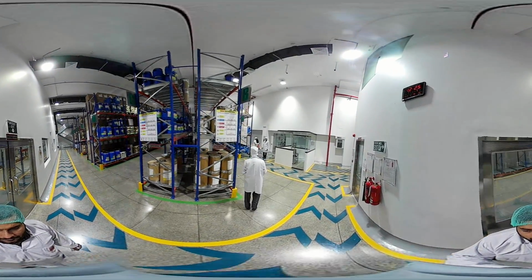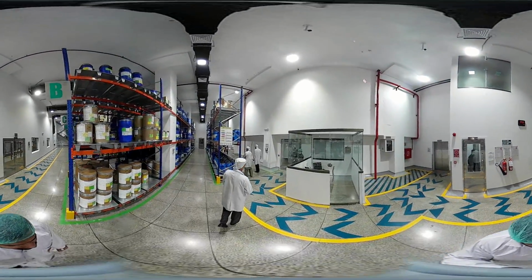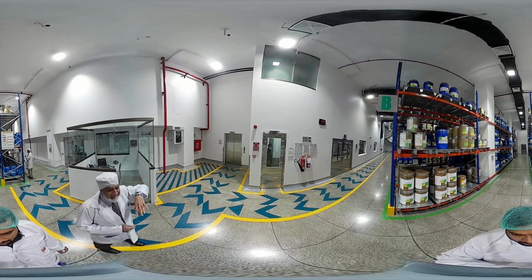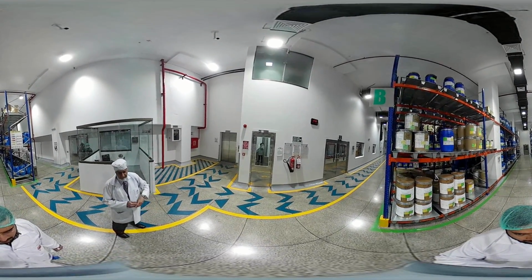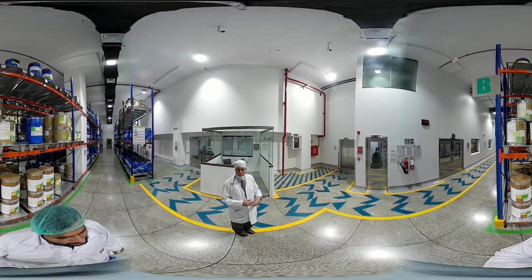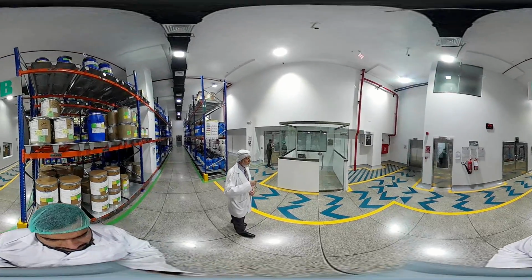From this we can now move, as per the floor, to the dispensing area of the warehouse. We also have 2 cargo lifts because, as I was telling you, we have 3 levels of storage area. Cargo 1 lift and cargo 2 lift are there. As per the requirement, if material is required from level 1 or level 2 to the basement, we use these cargo lifts. The sampling booth was there.